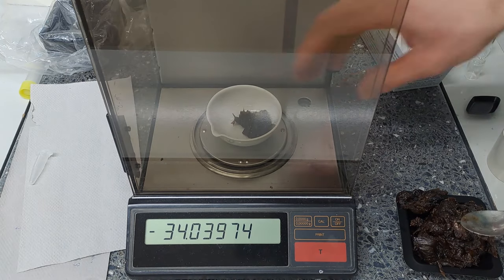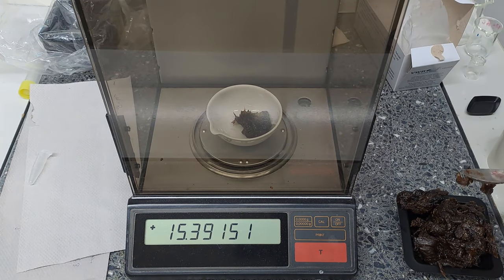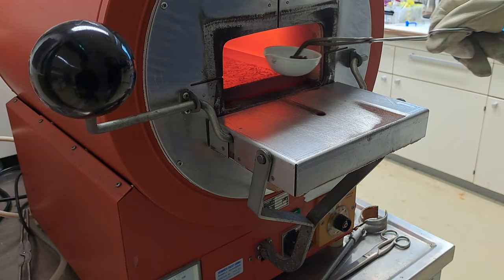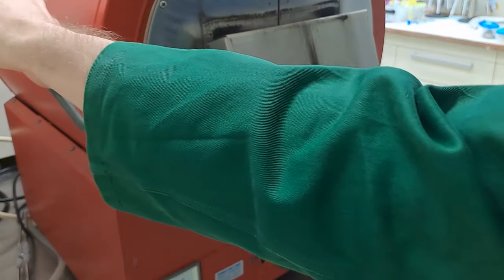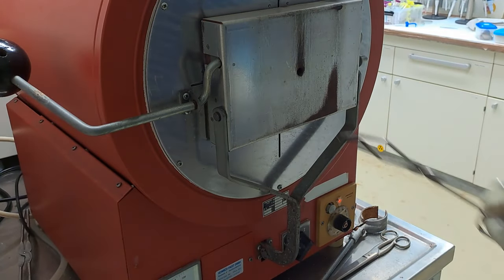This mush will be divided into portions of 15 to 35 grams. Each portion will be placed in a muffle furnace at 800 degrees Celsius for at least 45 minutes. You might ask, why not all at once? I don't want flames coming out of the furnace, okay?